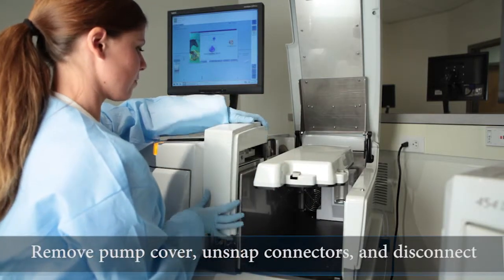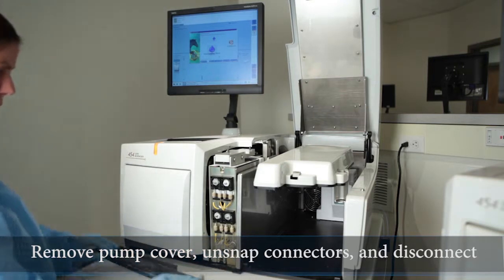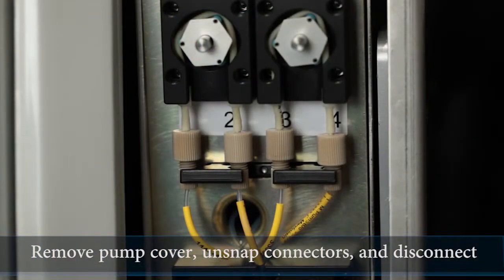Remove the pump cover, unsnap the connectors from their holding clip at each end of the pump tubing, and disconnect each end by carefully unscrewing the connector.